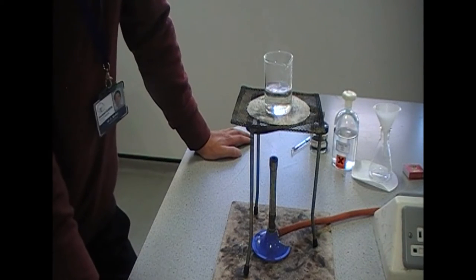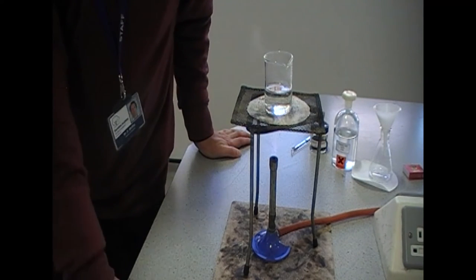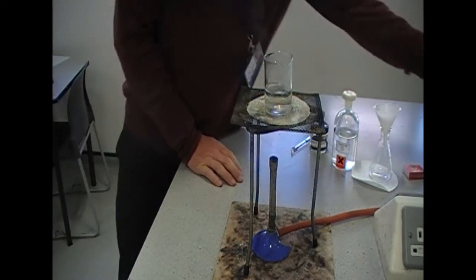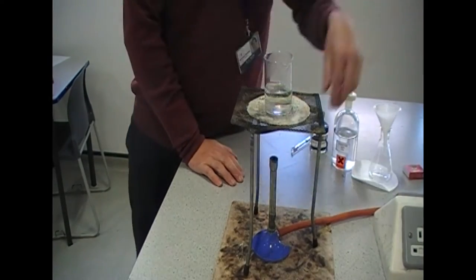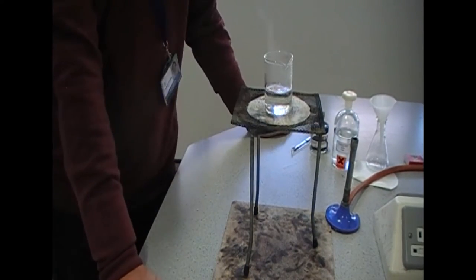As you can see it's just beginning to boil now. As it says, as soon as it's just about to start boiling, turn the Bunsen burner off. That takes us on to step three.